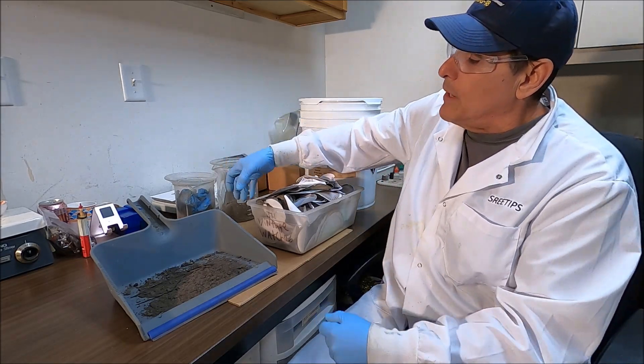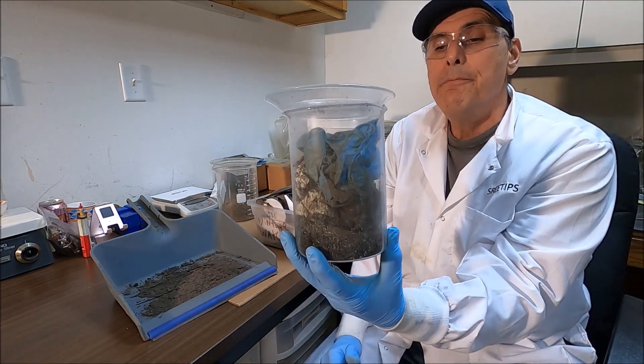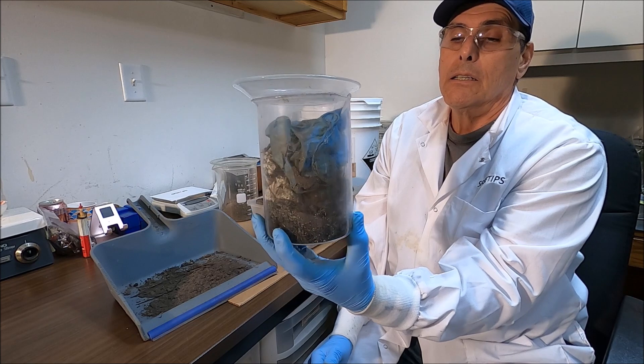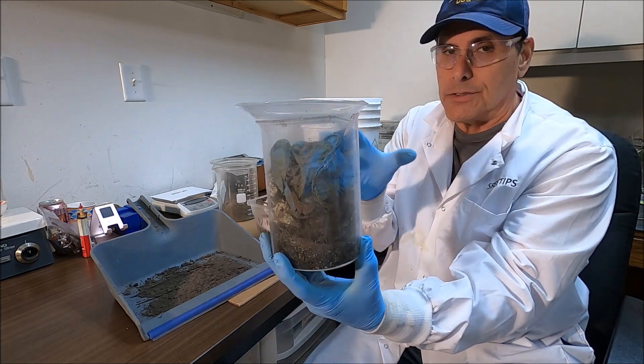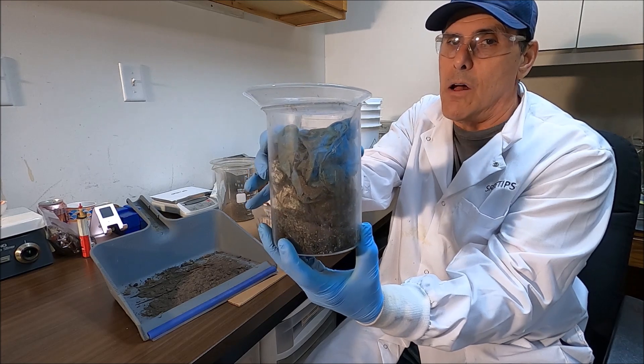I've got another jar that's got a bunch of waste in it from the first time I did my fume hood. There's some paper and gloves and stuff that I scraped off the inside of the fume hood and I saved it all.